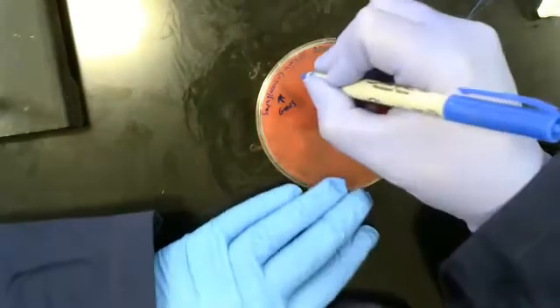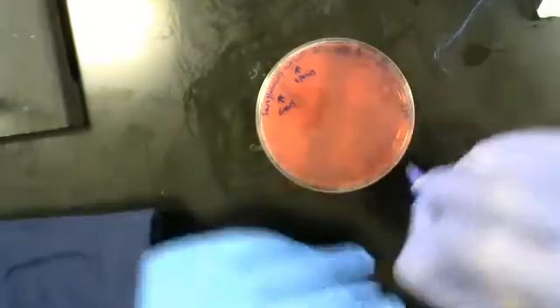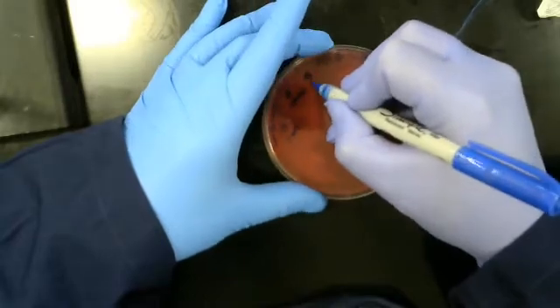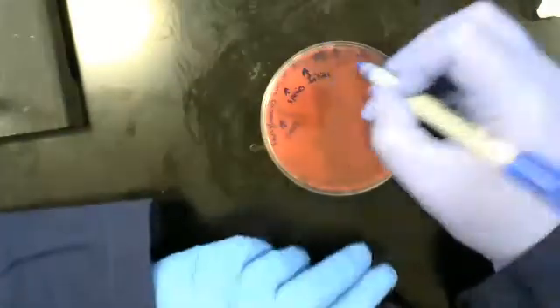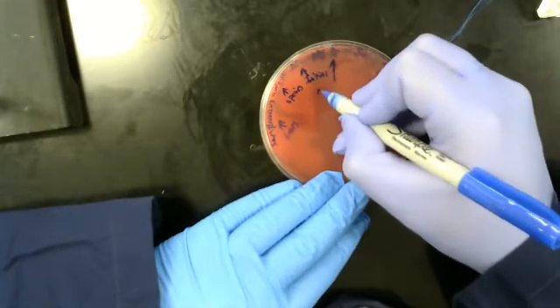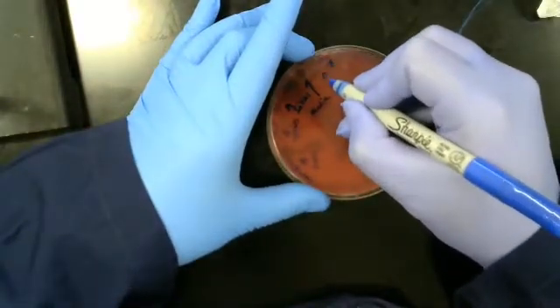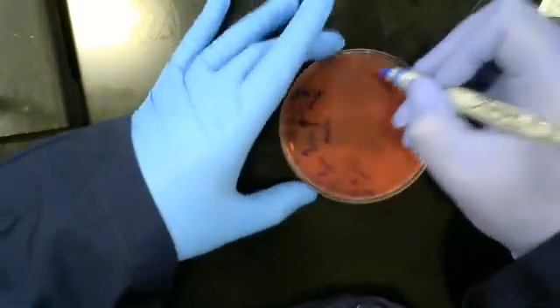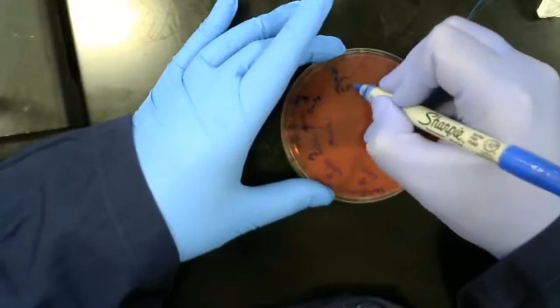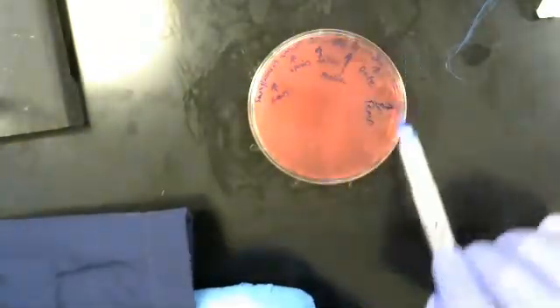Our genus, species, your initial, media type, date of inoculation, and incubation temp. These are the things that go on a typical plate.